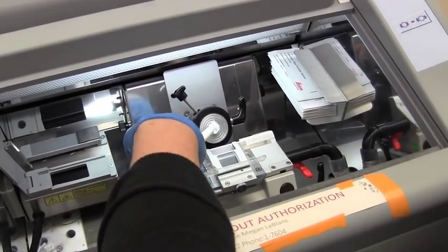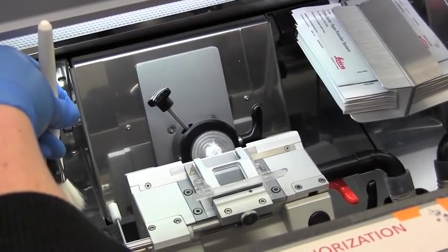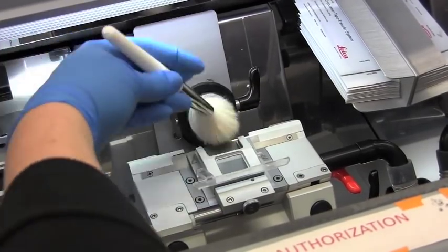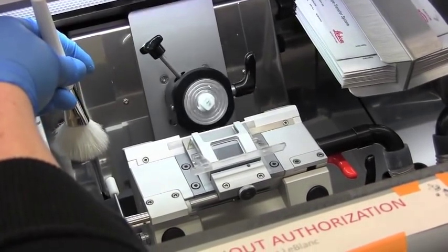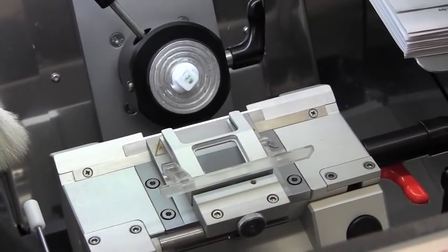Right now you can hear it's only hitting these corners because of the angle. But then we get a good cut into the matrix itself with a little bit of the sample. As we go deeper, the slice gets bigger because we're getting down into the actual tissue.